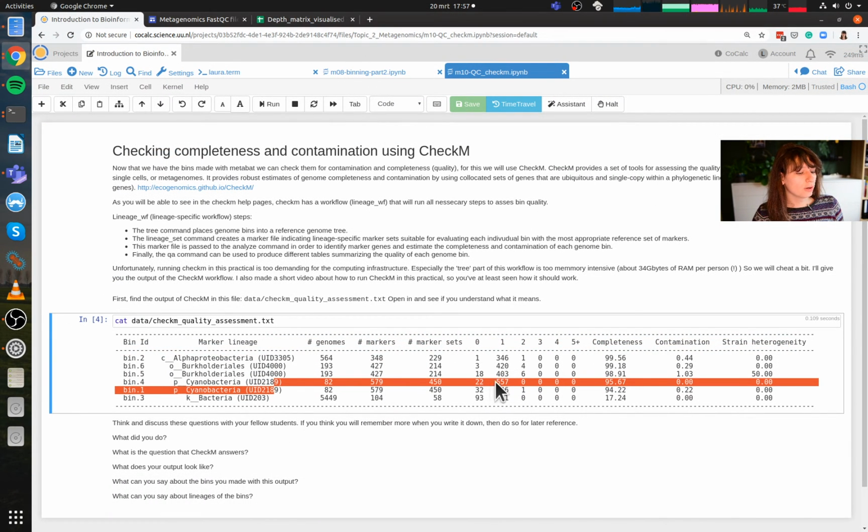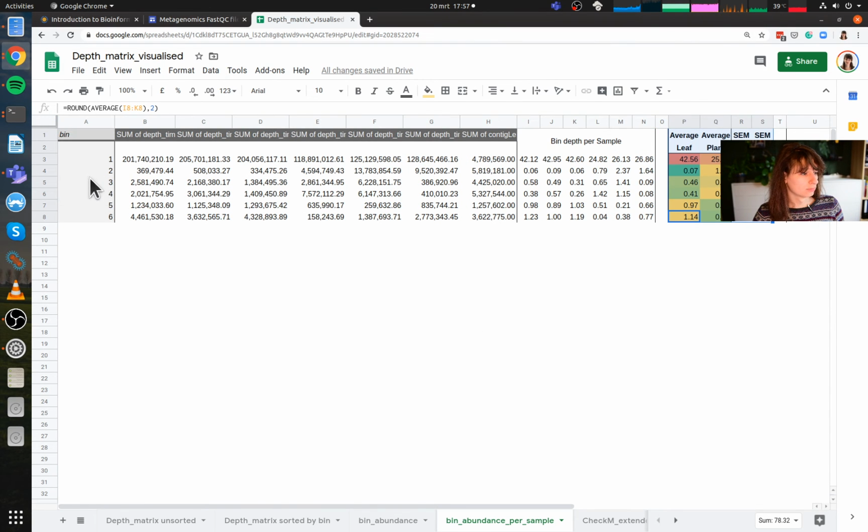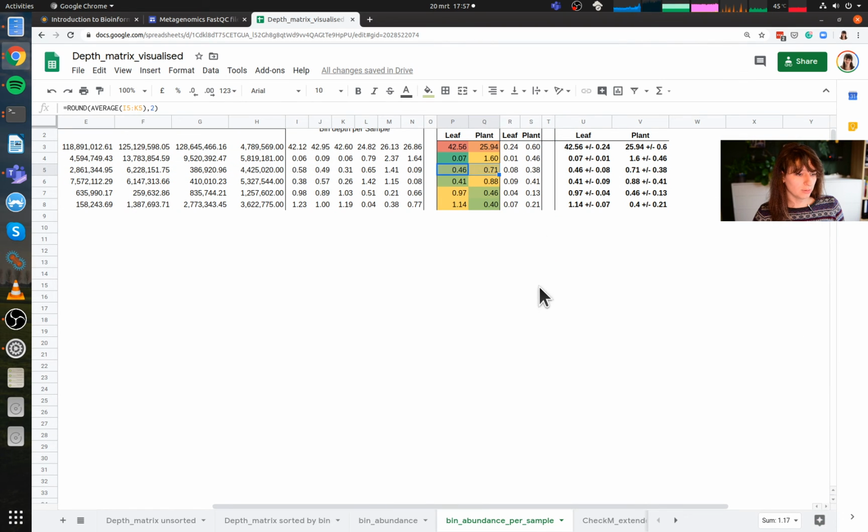And it's also a very nice thing to combine with this table we made earlier. So that's this one over here. So let's say bin 3 we throw out. So that's this bin we throw out. And then you have this table left. And you put the completeness and the contamination here on the side. It's nice to report this too, of course. And then you report completeness and contamination, and then you explain in your report why you're not using bin 3, but you are using the others.